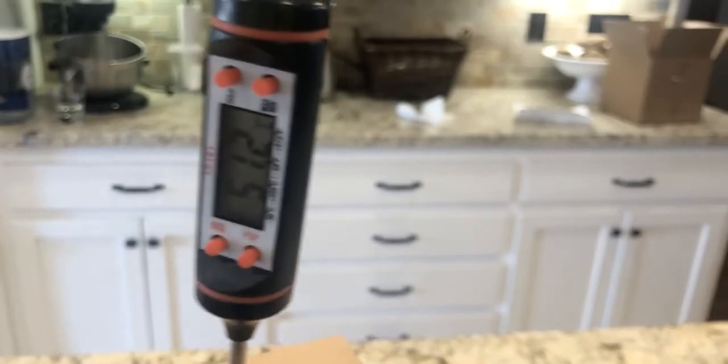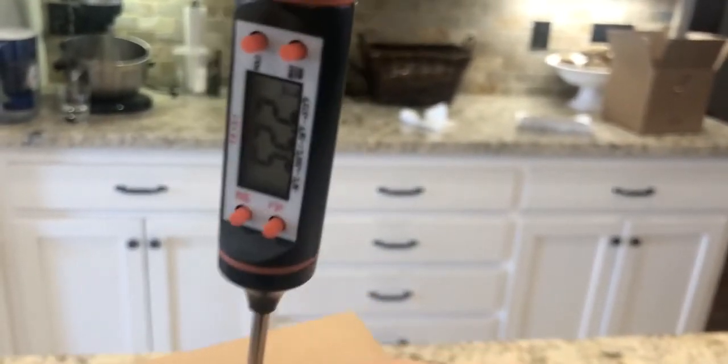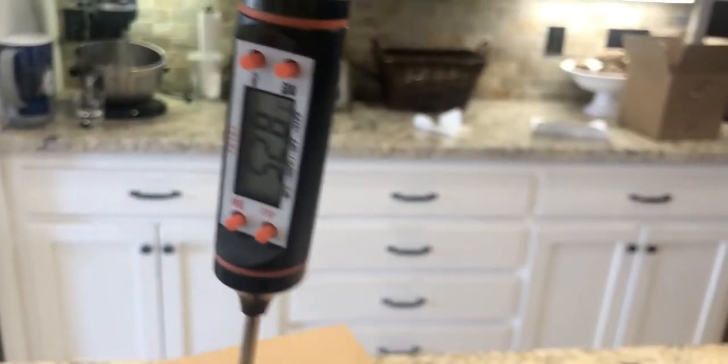I can see the temperature is going up: 51.2, 51.8. When the temperature stops changing I'm going to call that my final temperature.